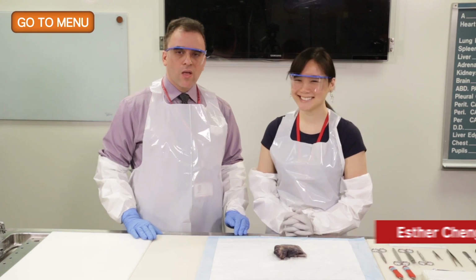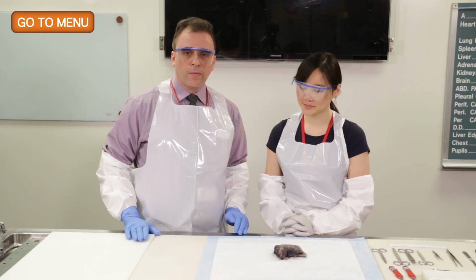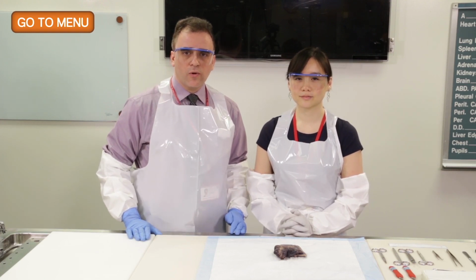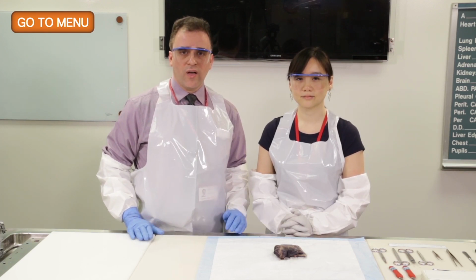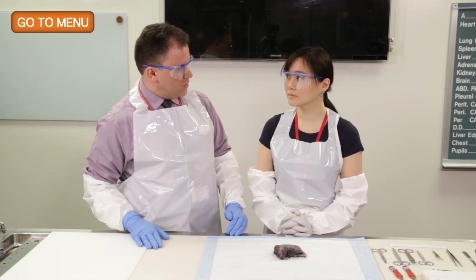While the gross evaluation of lung specimens is not the most common specimen in the gross lab, it does represent an important specimen type because of the severity of lung cancer and the importance of the gross evaluation for the purposes of staging. The first part of this is really pre-work.